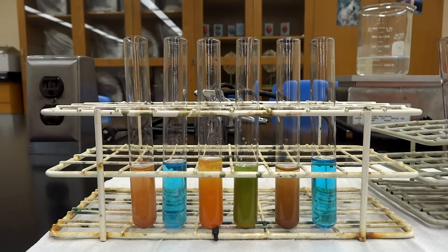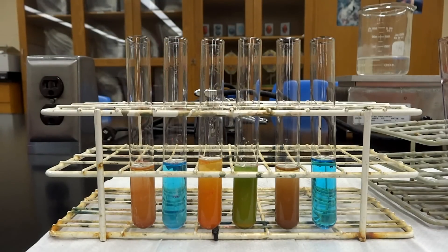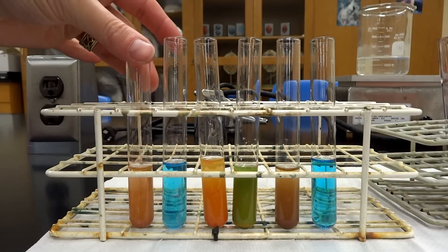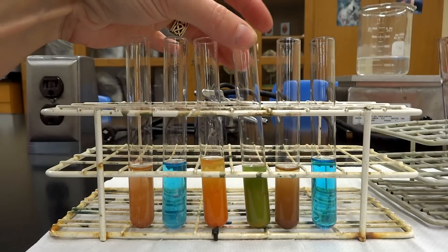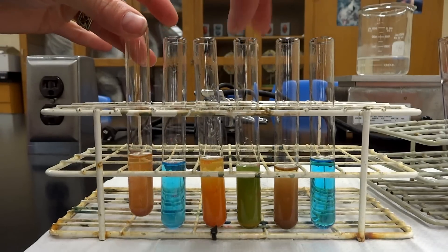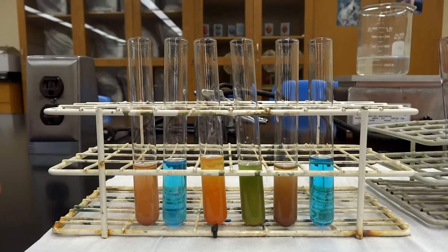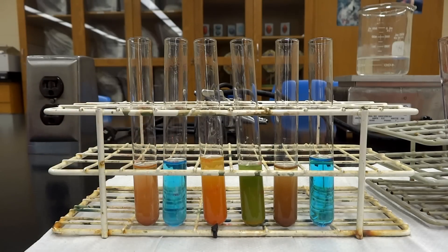By looking at tubes three, four, five, and six, you can see they are going to be similar to either our positive or negative control. Test tube number three is very similar to test tube number one, so onions have a lot of reducing sugars. Potatoes are somewhere in the middle — they have some reducing sugars but not nearly as many. There's kind of a sliding scale: the more orange-red, the more reducing sugars; the greener or yellower, the fewer.